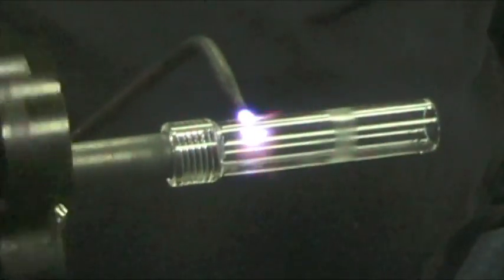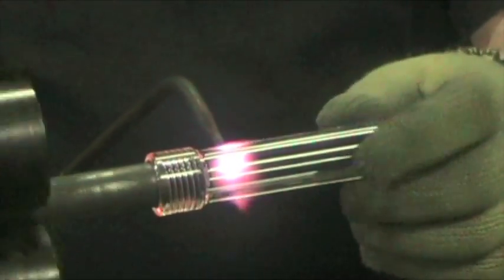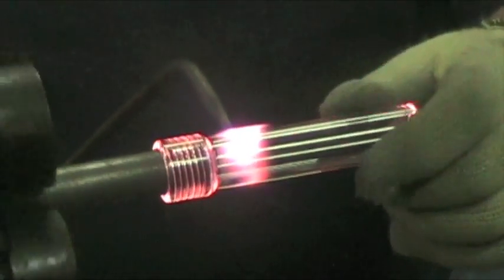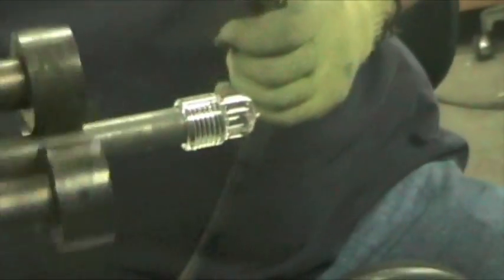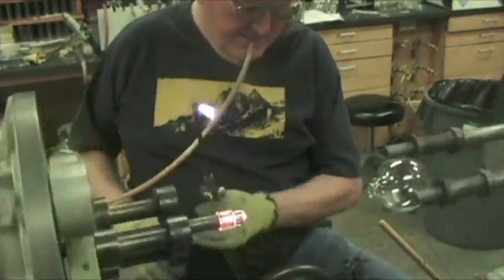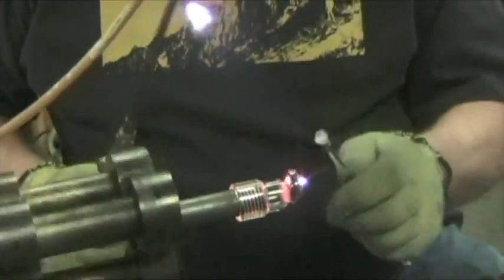Now I've got to take the extra glass off of this piece so it'll fit the way we want it. This is fairly thick wall and a little harder to take off. This is a blow hose that enables me to blow air on the inside of that, and that's why they call it glass blowing. See how I blow this out?